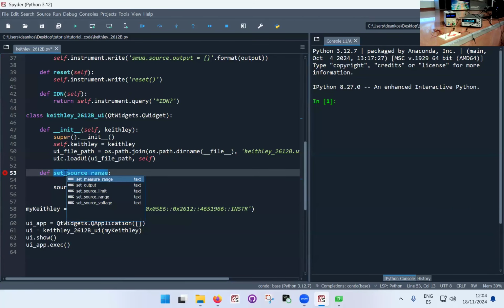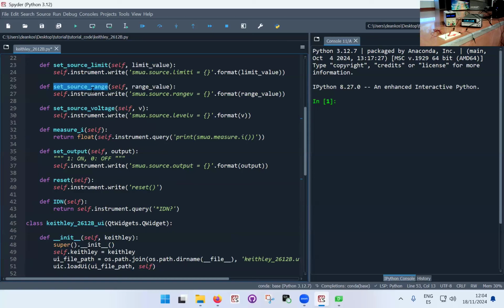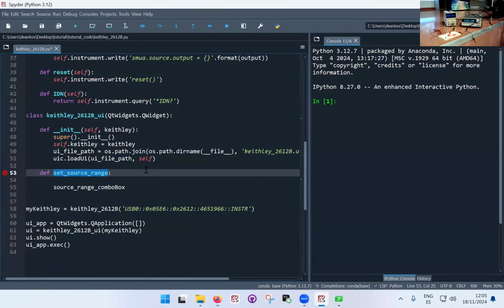And here you could use, there's no problem really, because this is a separate class, okay? There's no problem really in using the same names as in the original Keithley instrument class. I would say I often actually do that deliberately, but in this case, just for the sake of clarity, I'm going to give this a different name. So all these functions that we had earlier, I'm going to re-implement basically to say that they are coming from the user interface. So set source range from UI.